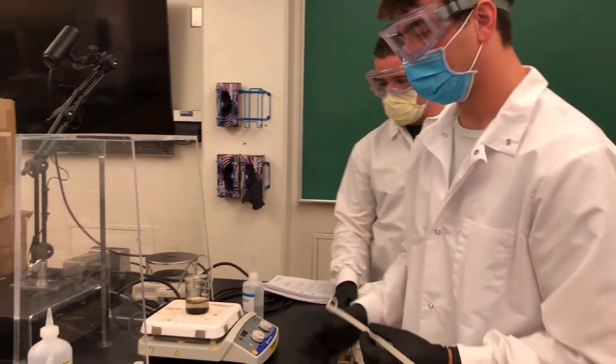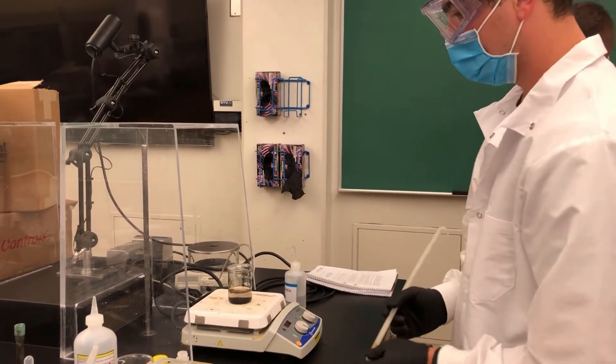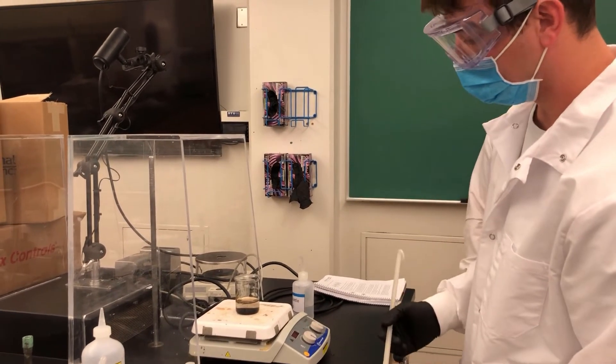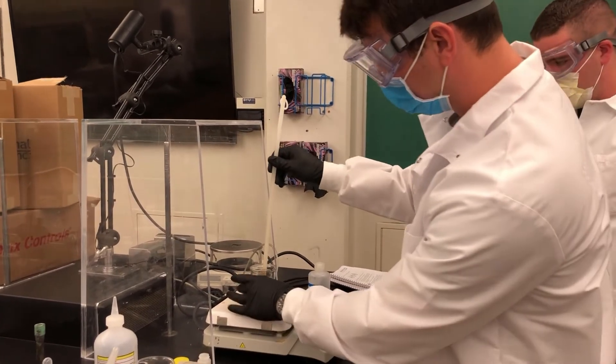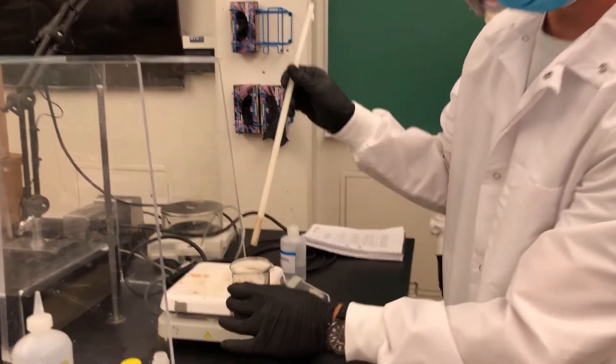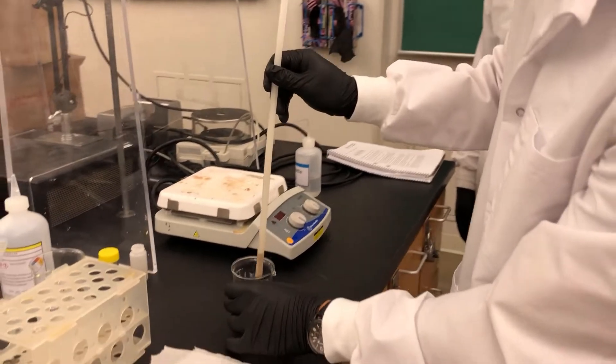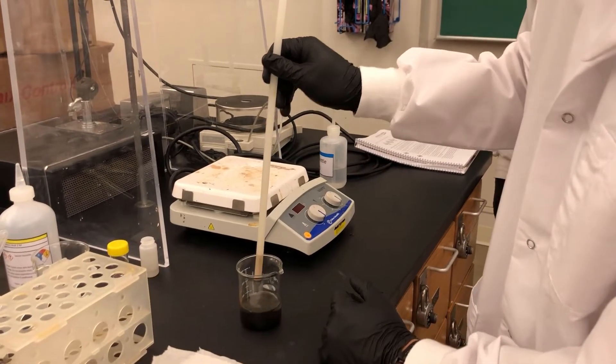Okay. We just finished adding our ammonia in a drop wise fashion to our iron chloride solution.